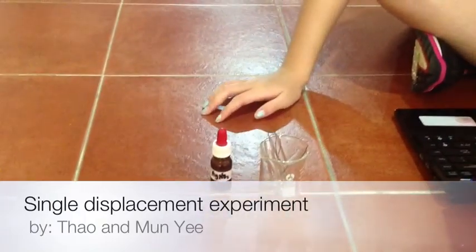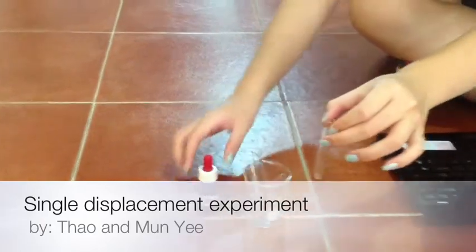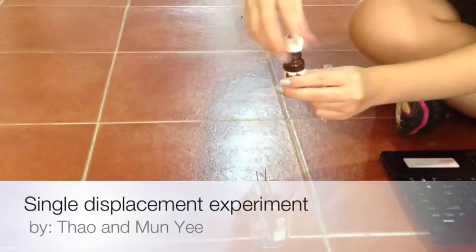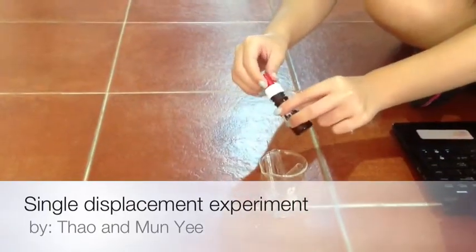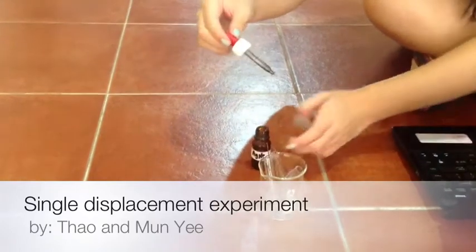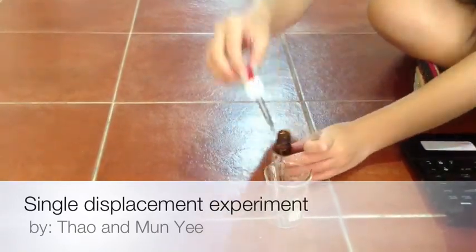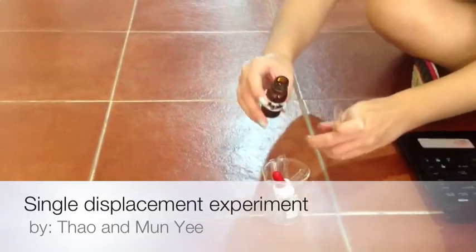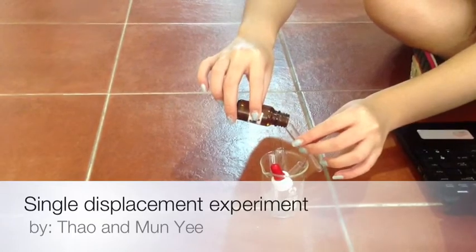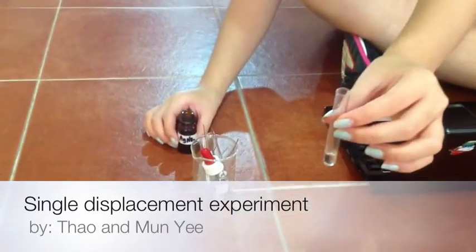First, place a few drops of silver nitrate in a small tester. About this much is enough.